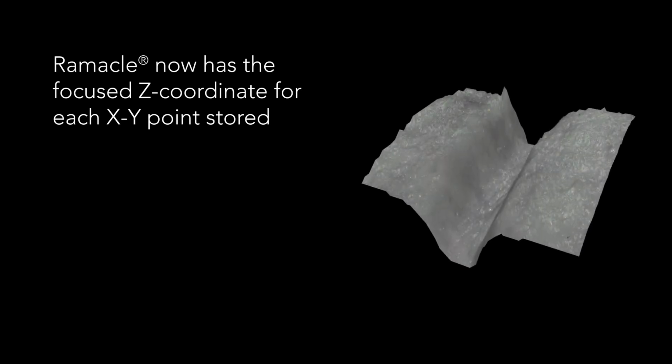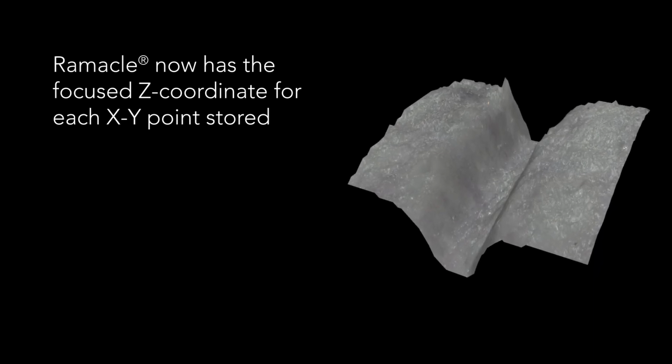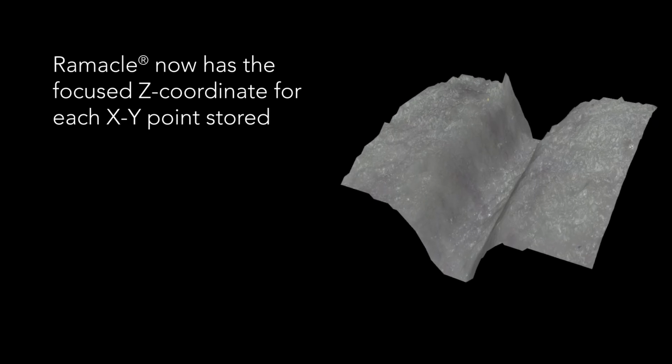Ramacle now has the focus Z coordinates for every XY point stored, and we can view our surface image in 3D topography view.